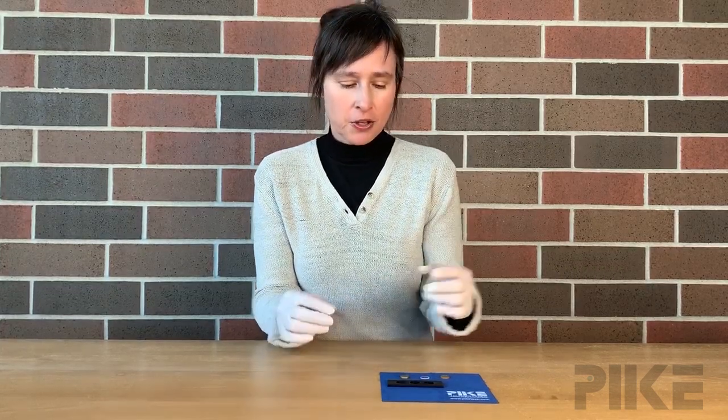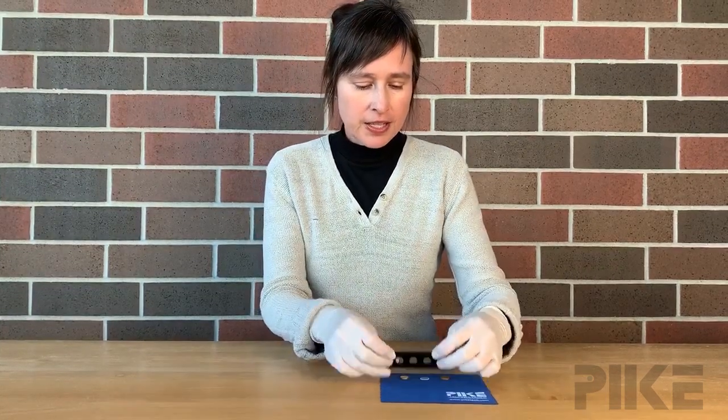Welcome to this week's tip of the week. Today we're going to talk about microsampling. Some of the challenges are just holding your sample. For those doing transmission or reflection measurements using an FTIR microscope, consider this simple three position slide.